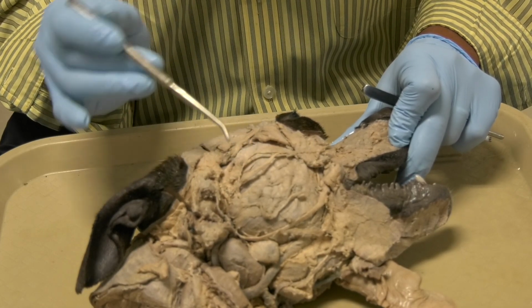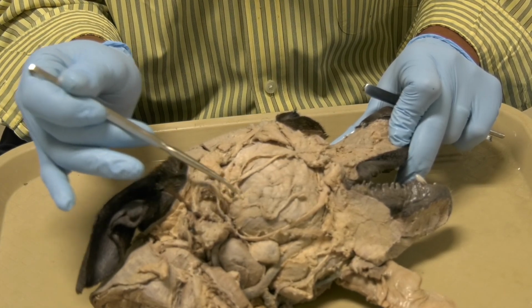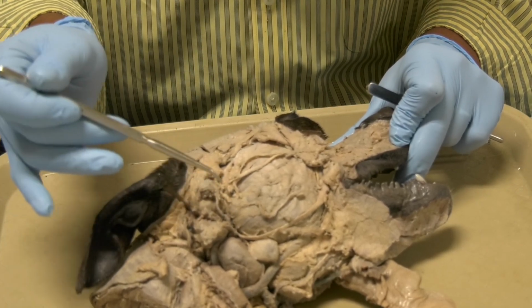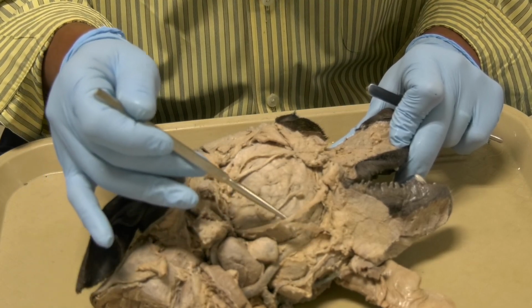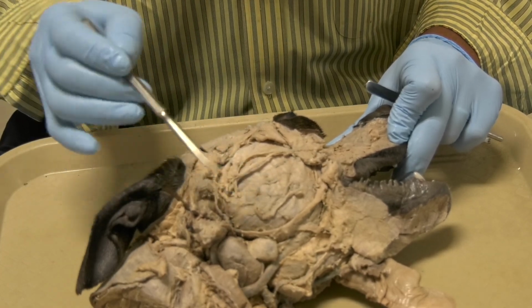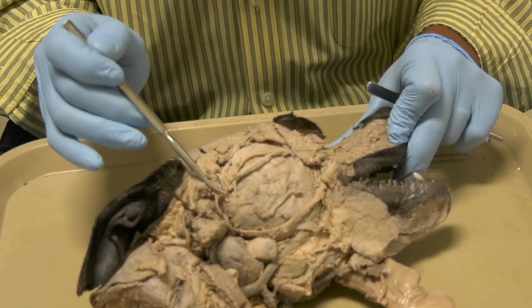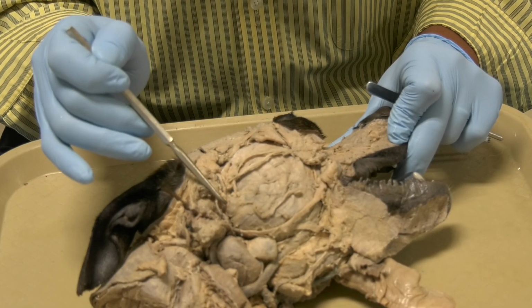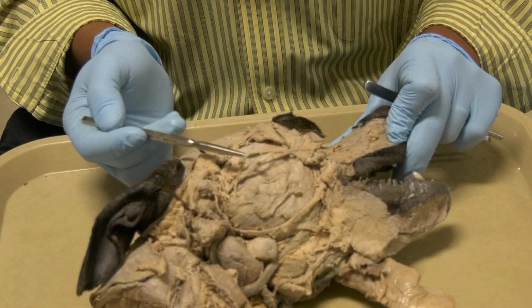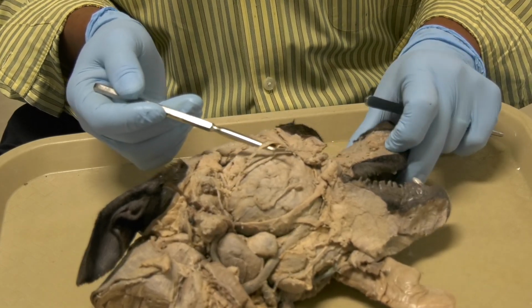Be very patient when you come to dissect in this area here, okay, and separate the facial from the mandibular, separate the branches of the facial, which are ventral and dorsal buccal and auriculopalpebral, okay, and try to find the mandibular and try to find the auriculotemporal branch of the mandibular, and this is sensory to the face, okay.